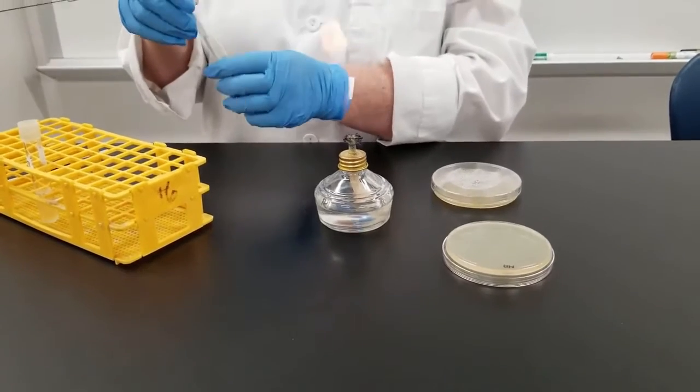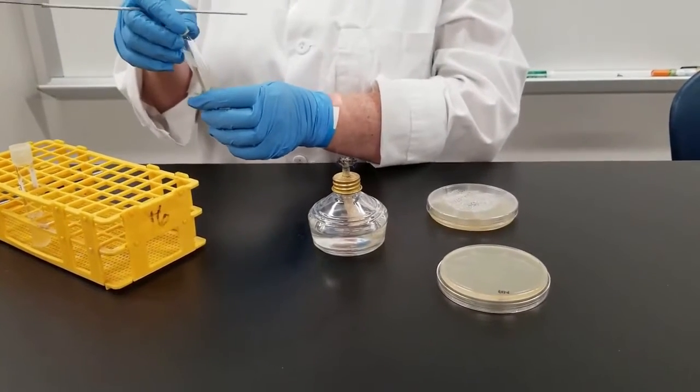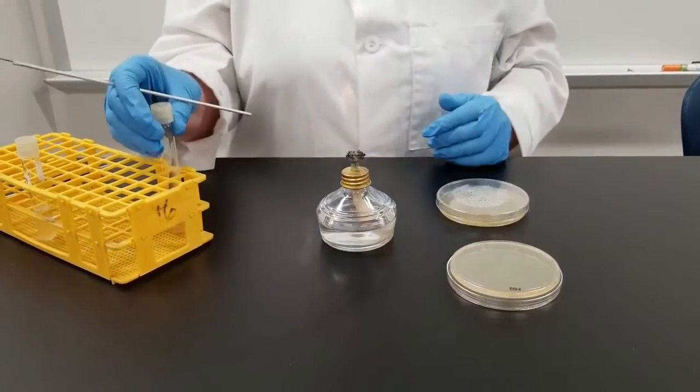Oftentimes when you're working with test tubes, you may want before you get started to loosen the lid just so it'll be easier when you're ready to go for it.